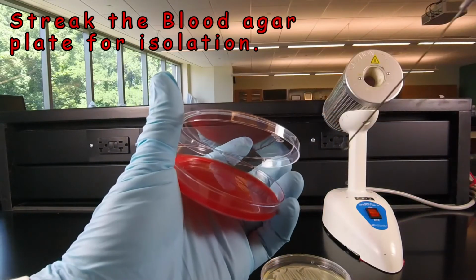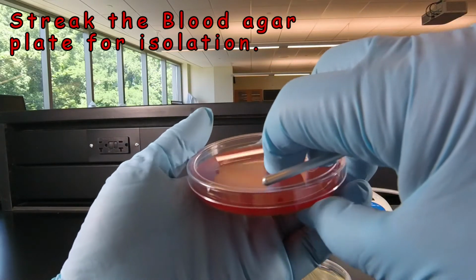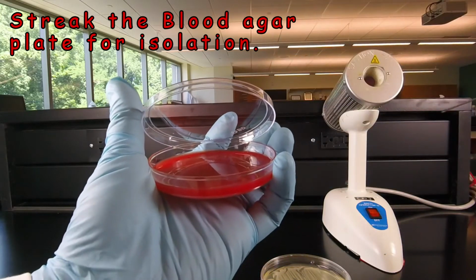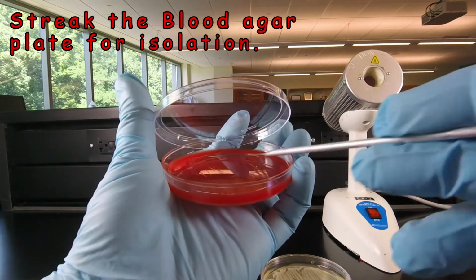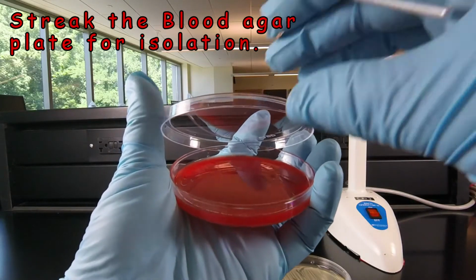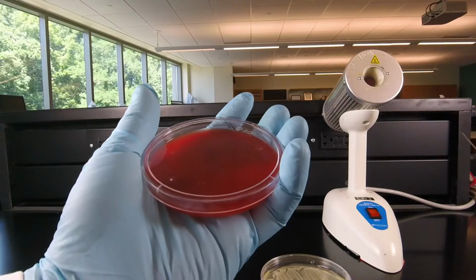Stick it in the agar to cool off at the very edge. Rotate the plate so that sector 2 is sitting at 9 o'clock. And we'll take our sterile loop, pick up some bacteria from sector 2 by dragging it through a couple of times, and spread that out over sector 3, being careful not to touch sector 1. So that's our normal streaking for isolation that we learned earlier.